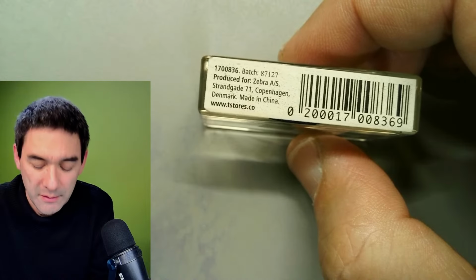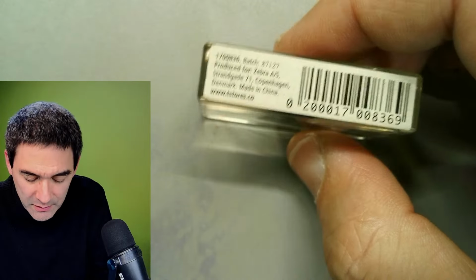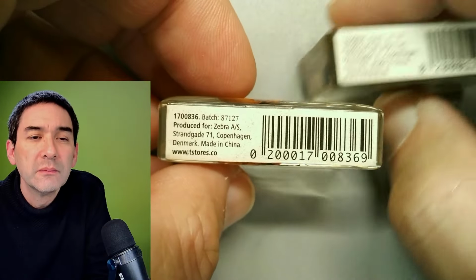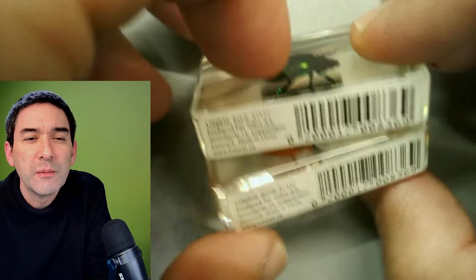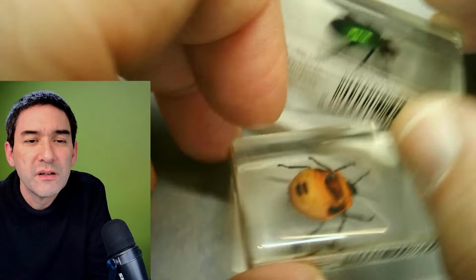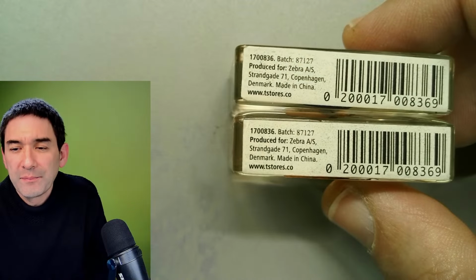Especially assuming that they were being bred in a company. See, they all have the same sticker on it with the same code, even though these are different insects. So that's a little bit of a pity, but yeah, just saying.